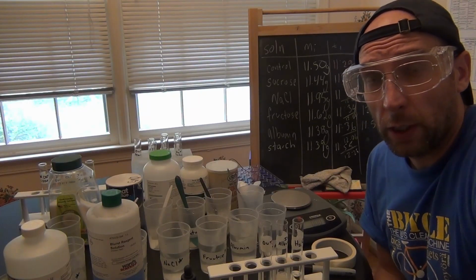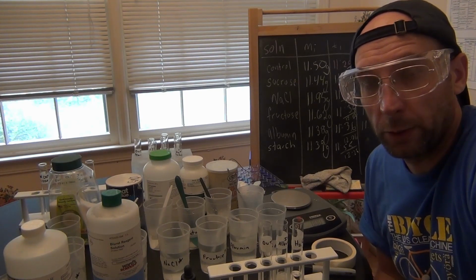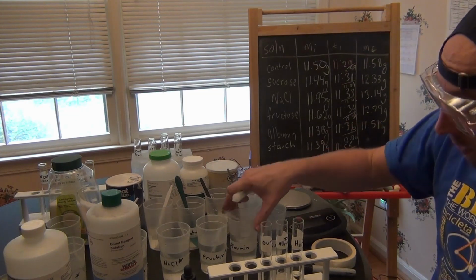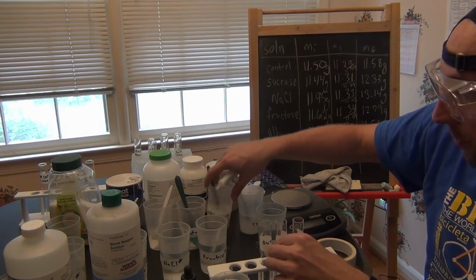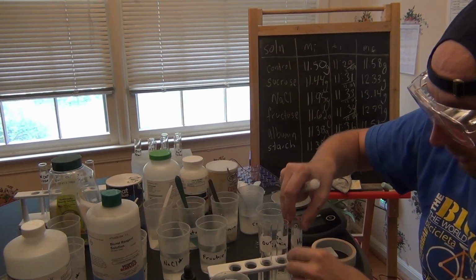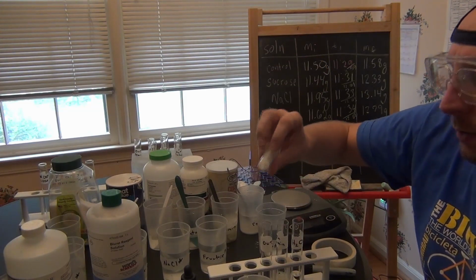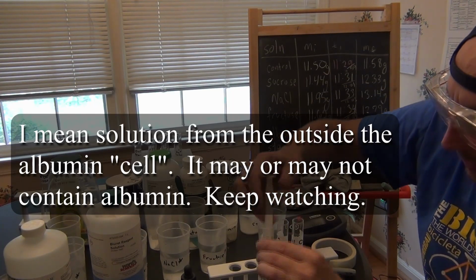Okay, while I wait for the starch, I'm going to start doing some chemical tests to see what has moved outside of the dialysis tubing. So we're going to start by testing to see if protein can move outside the dialysis tubing. So albumin is a protein, right? So I have my albumin container here. And I took some of the albumin that went inside and I added it to a test tube. And then I also took water that was originally on the outside and added that to a test tube. Now I'm going to take a sample of albumin from the outside and we're going to put that in this test tube here.